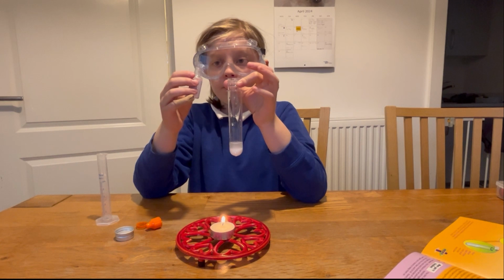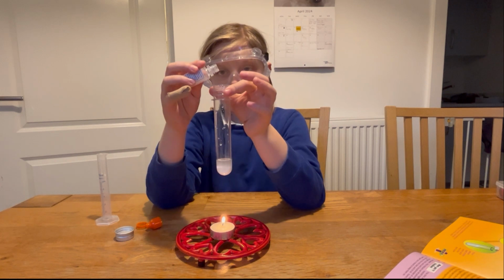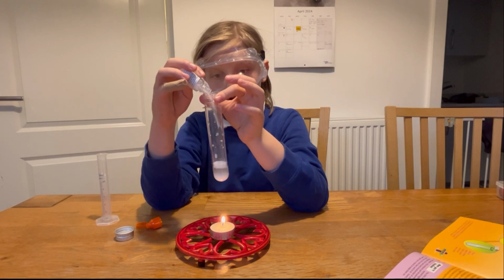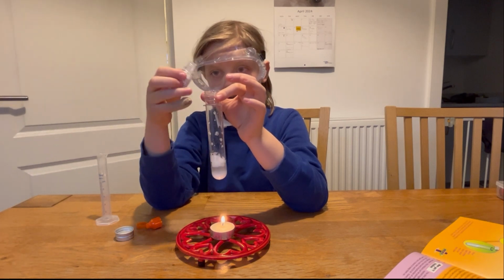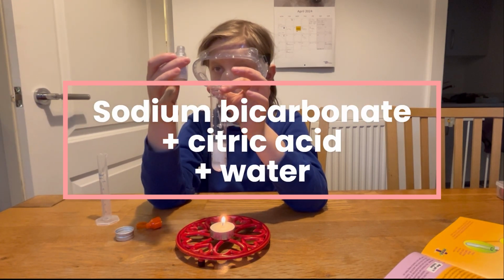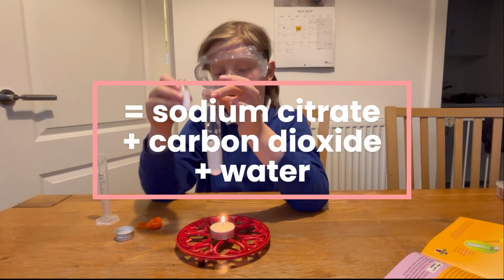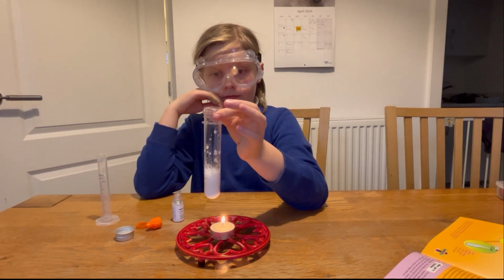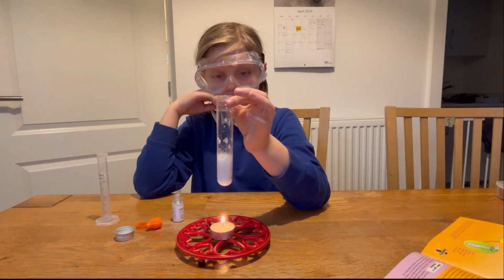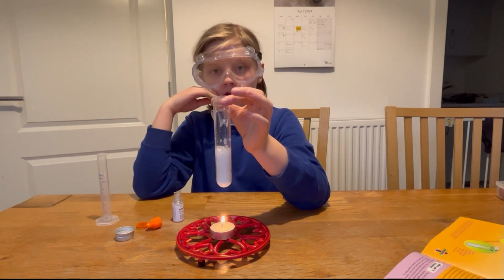Now we are going to pour our citric acid into it to get the reaction. So we're going to pour half of it in. Oh, it's fizzing. Is that half? No, I need a bit more. There we go. You can see it bubbling and fizzing, and I can feel some air coming out the top.